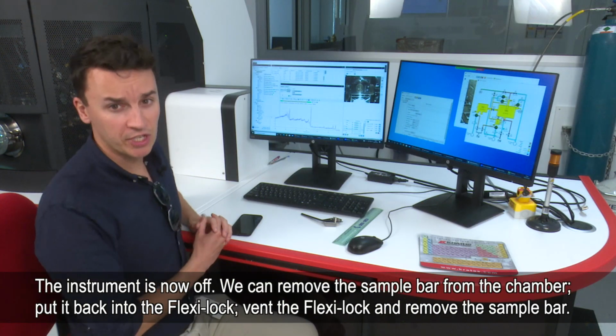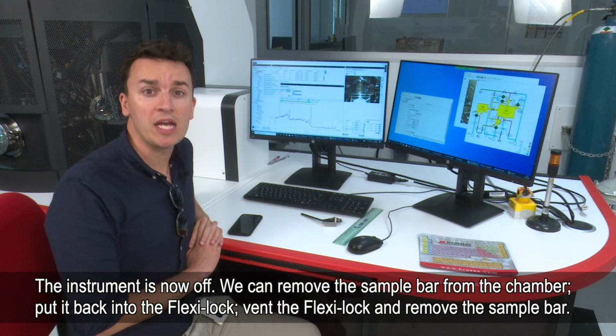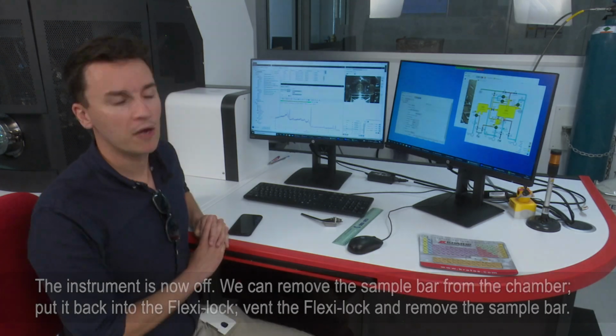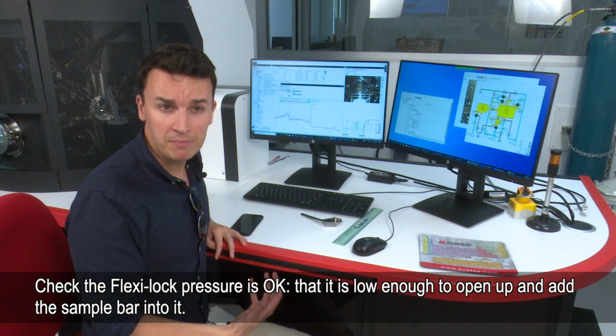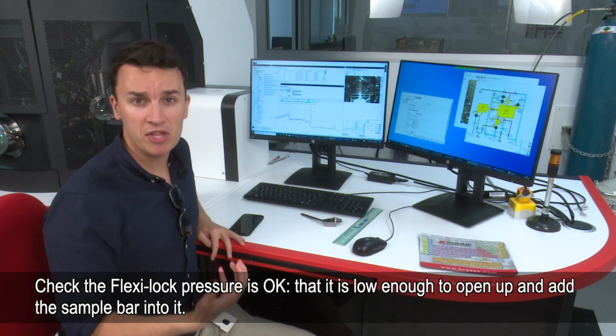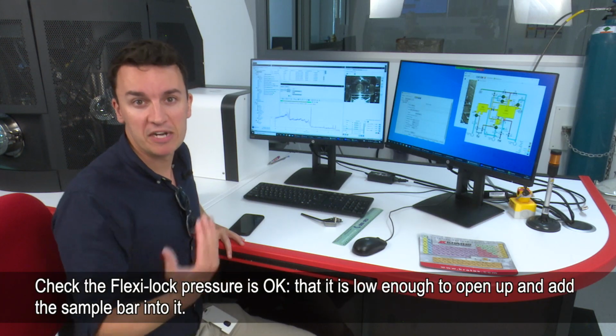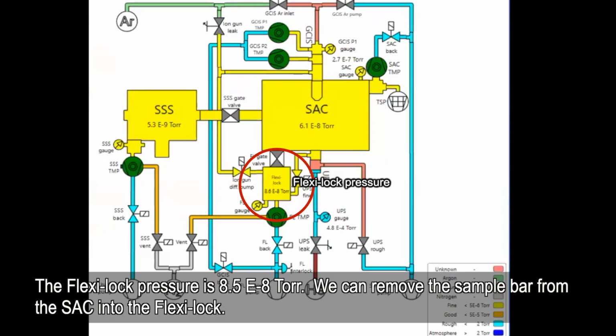So now the instrument has turned off, we can remove the sample bar from the chamber, put it back into the FlexiLock, vent the FlexiLock, and then remove our sample bar. Before you move the sample back into the chamber, you just have to check that the pressure in the FlexiLock is okay, it's low enough to open it up to add the sample bar into. So as you can see now, the pressure in the FlexiLock is below where it should be, it's in the -8s, and so we can now remove the sample bar from the sac into the FlexiLock.